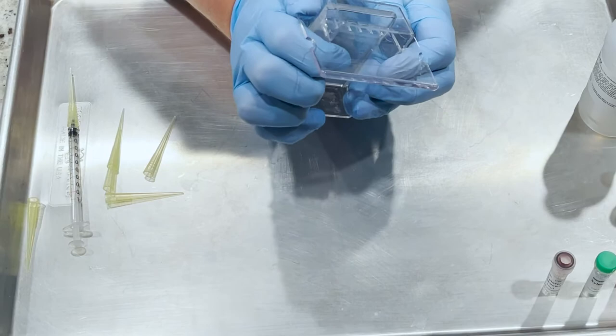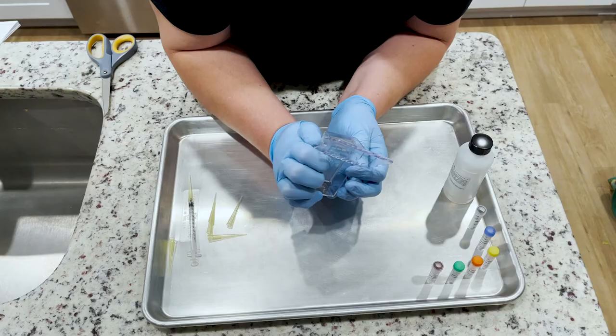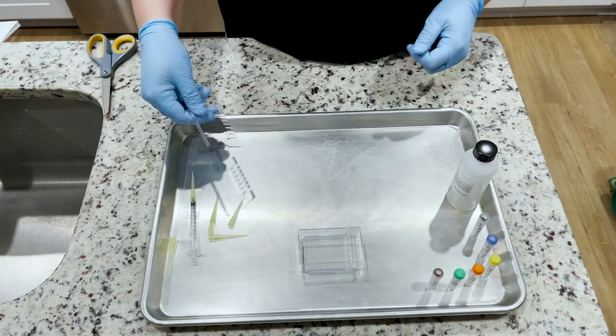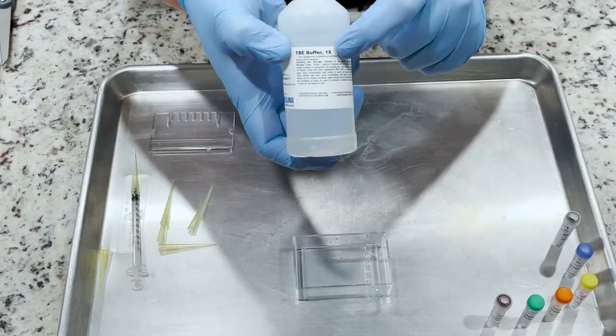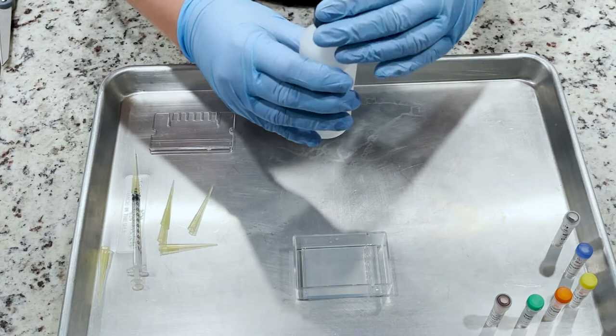It will take your gel about 30 minutes to set. After it is set, you should gently remove the comb. You'll notice that it will look kind of like a clear jello in the bottom of the gel container.